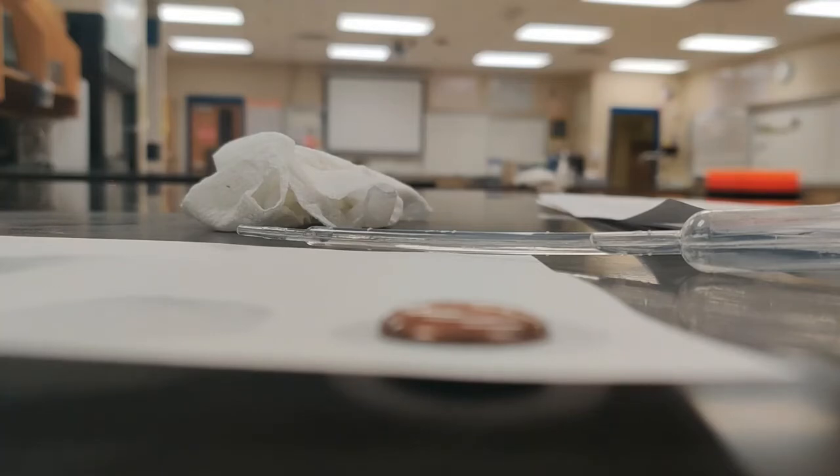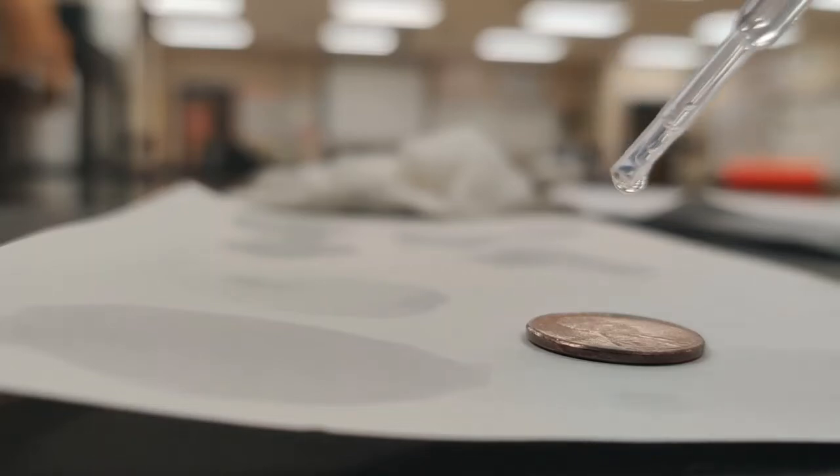But it's interesting because it's kind of going in all directions, where the salty water really tended to, when the water bubble rolled off, roll off in one direction as opposed to rolling off in all directions at once. So let's go ahead and try our trial number 3.